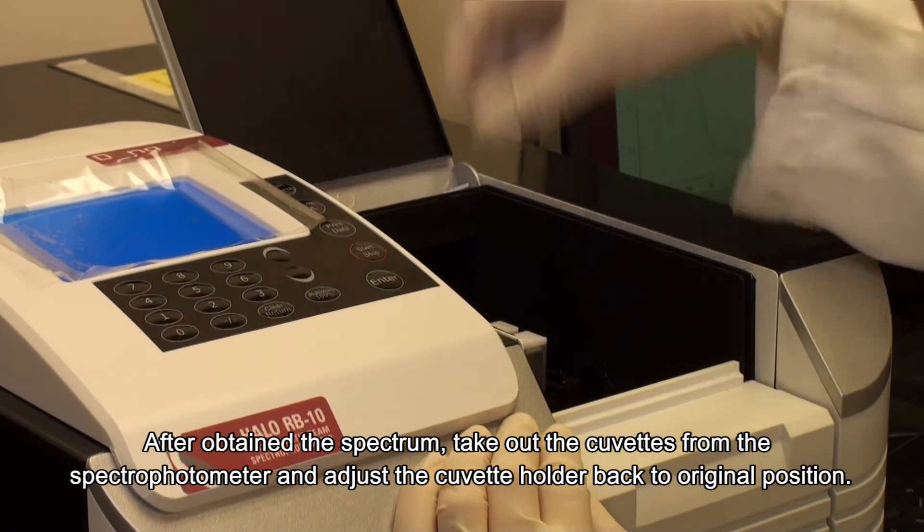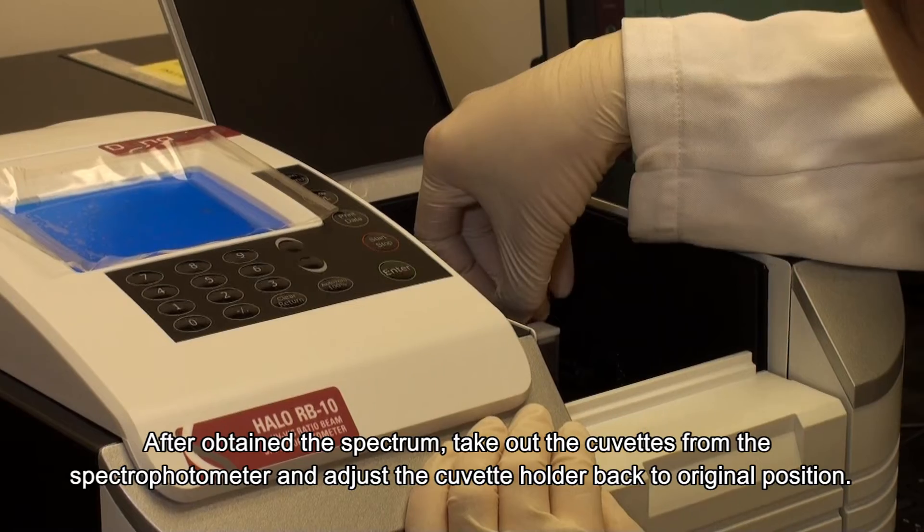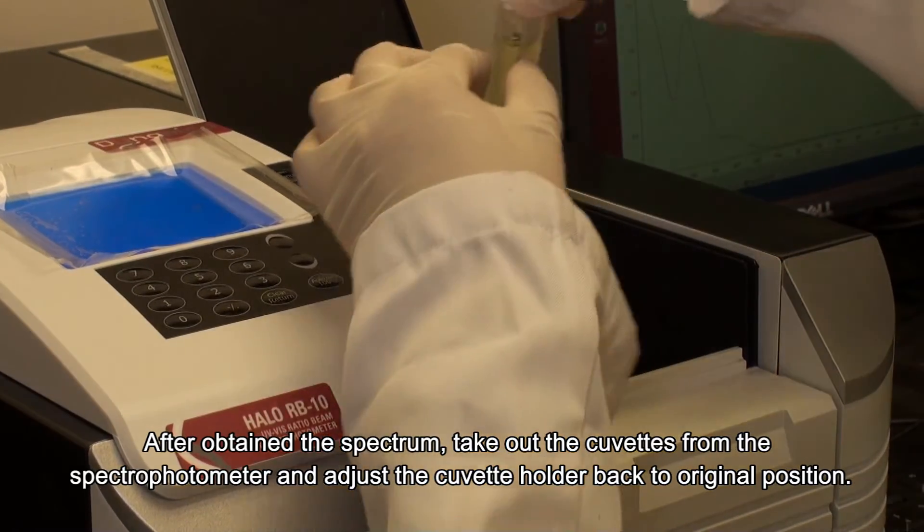Take out the cuvettes from the spectrophotometer and adjust the cuvette holder back to original position.